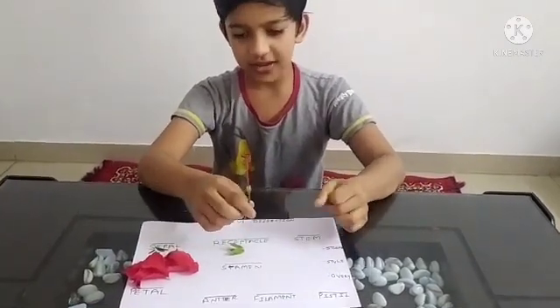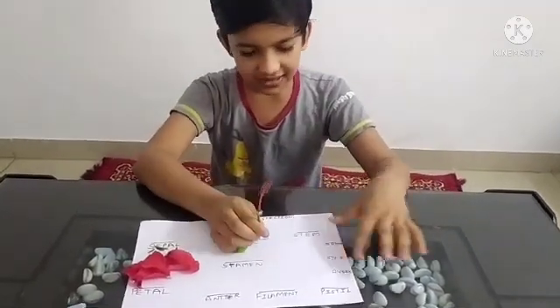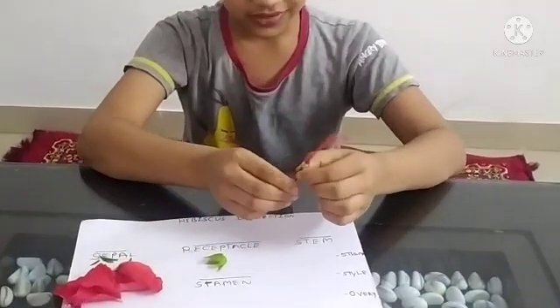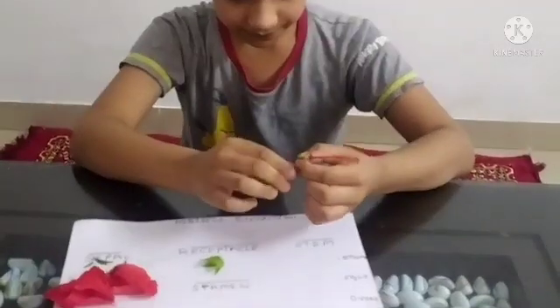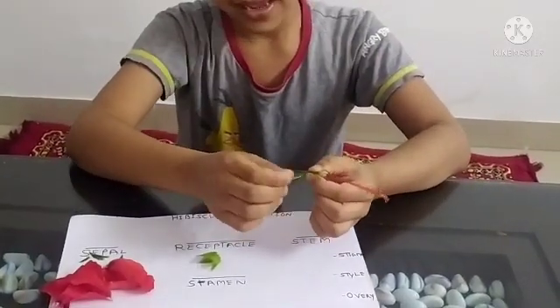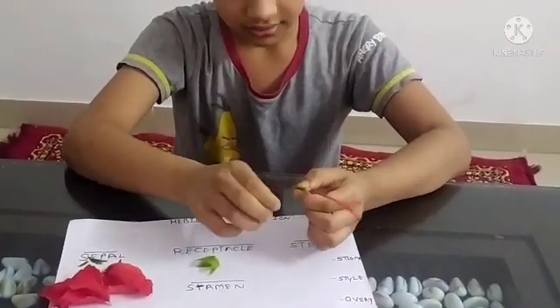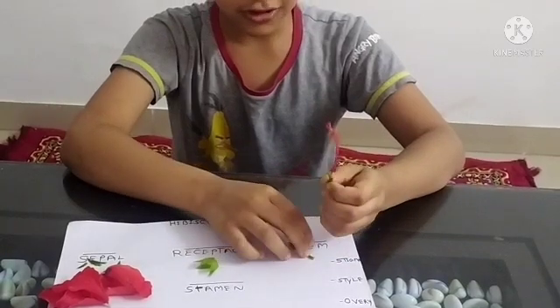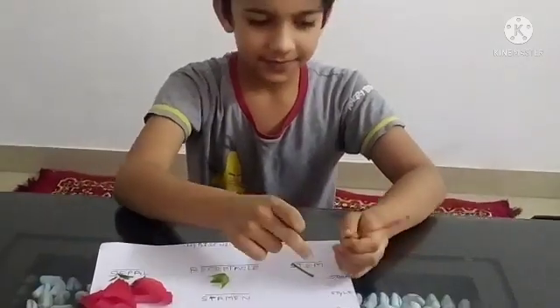Now the stem is causing a little problem. We will remove our stem like this. Take out carefully because we don't want to damage our ovary.